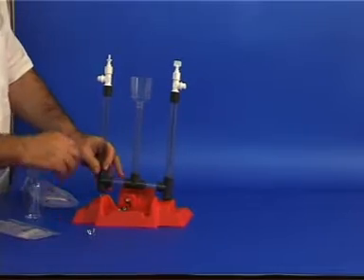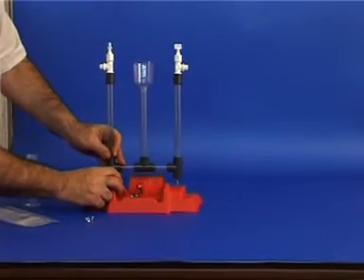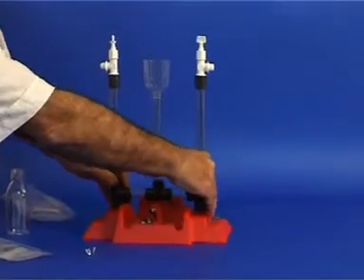First, assemble the apparatus. The two screws protruding from the apparatus must be inserted into the base.